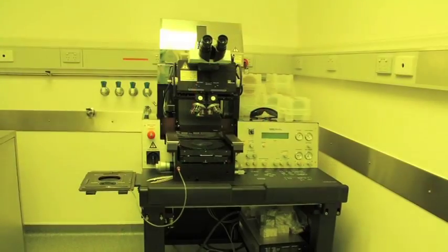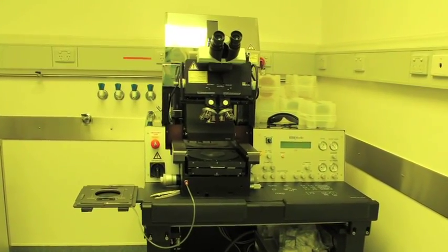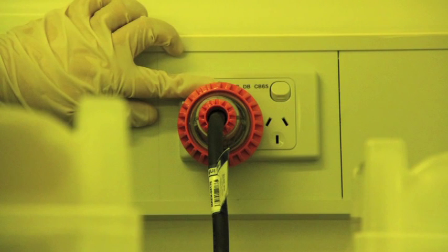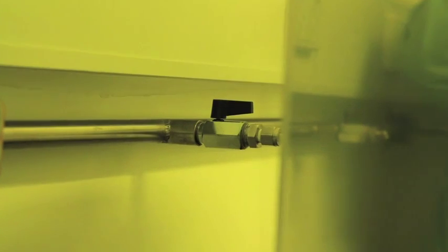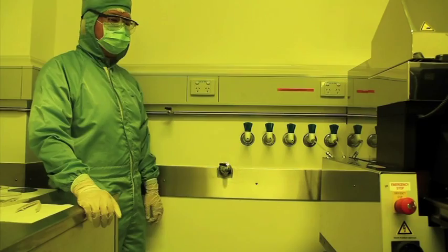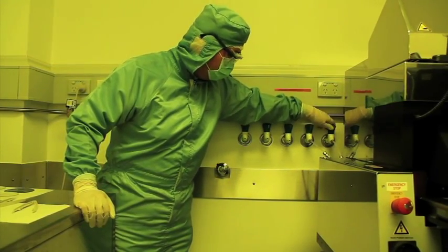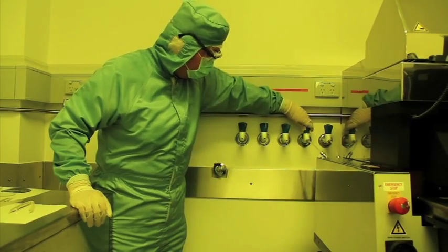The UV lamp house door, bulb and sockets are extremely hot when the machine is on. Turn on the mask aligner at the power outlet and the air and nitrogen taps. The nitrogen is used to cool the UV lamp. Without cooling, the lamp could explode and emit a poisonous gas.